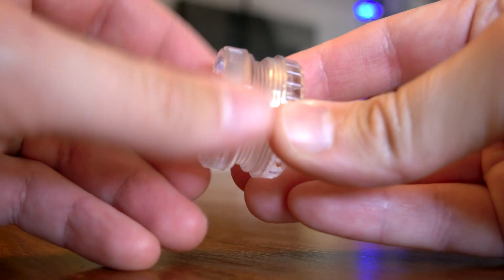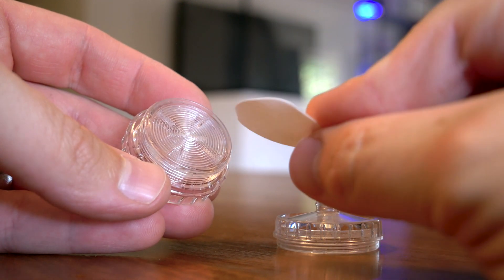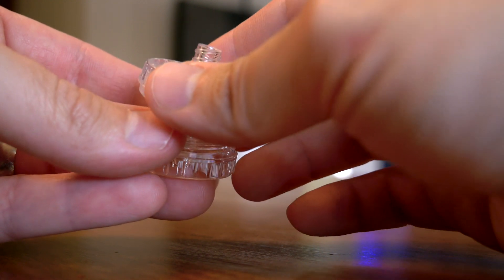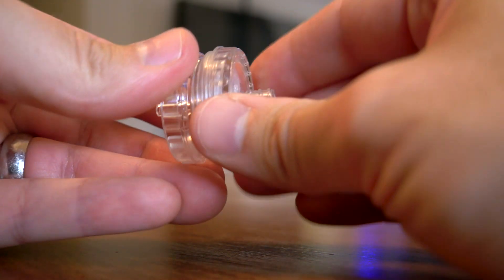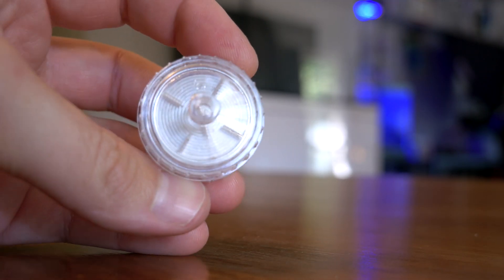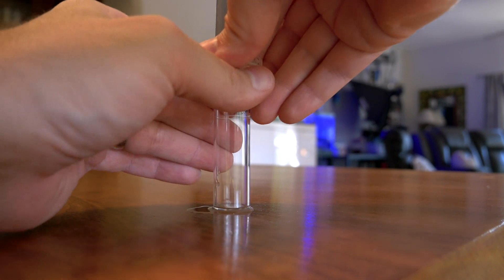You have to unscrew the two halves of the reusable plastic filter and carefully place one paper filter on the lower piece. The upper piece is marked 'top' — at least that's what the directions say. I couldn't find it marked anywhere. Just follow along with this video to see which piece is which. Ensure that the filter paper is on top of the clear colorless gasket in the filter holder. Why you would make a clear, colorless, tiny gasket and not offer a replacement is beyond me — it's one of the most important pieces in the entire test kit. Thread the upper piece over the lower piece and tighten securely. You have to tighten this so much that when you're done and trying to clean it, it is almost impossible to remove.